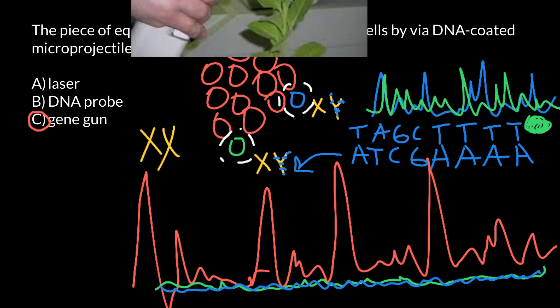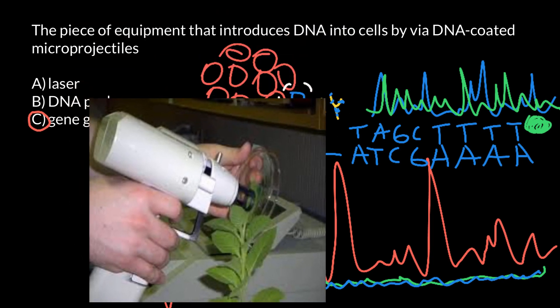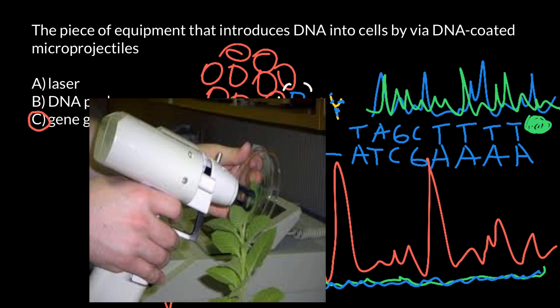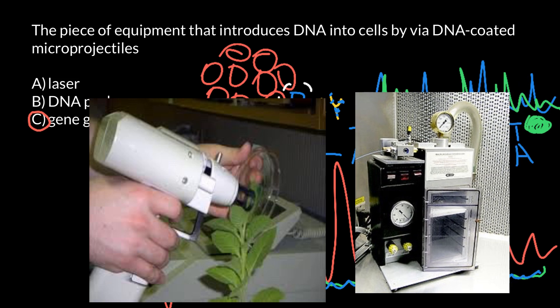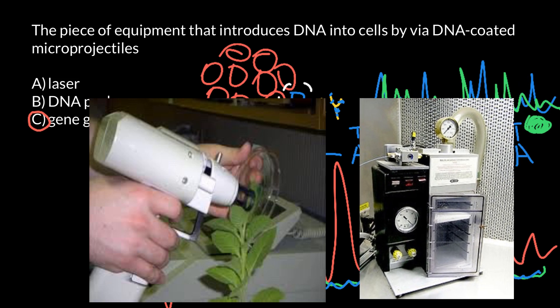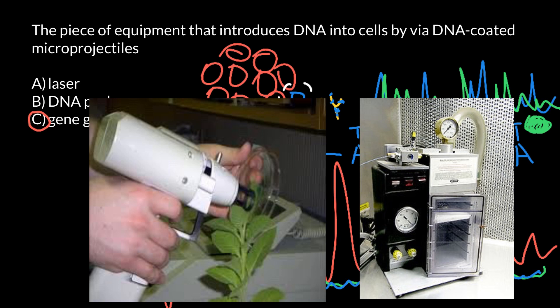Here is a picture. As you see, it does look like a gun, but sometimes it doesn't look like a gun. For example, take a look at this picture — this is also a gene gun, but this time it looks like a chamber. The principles, however, are the same.